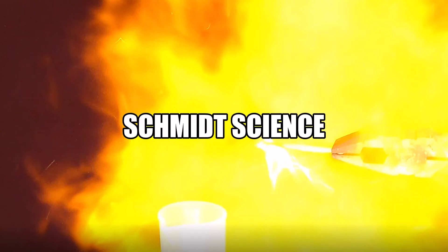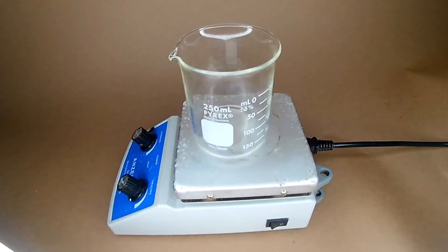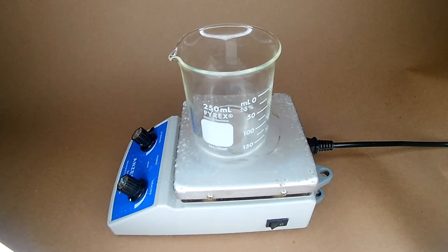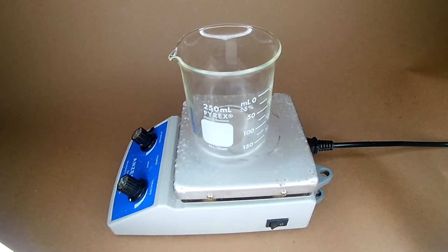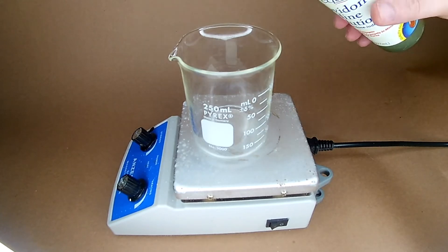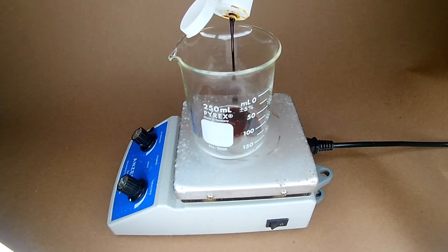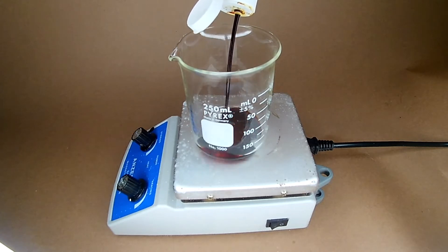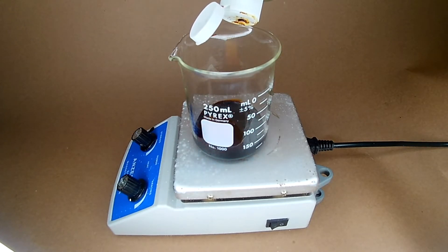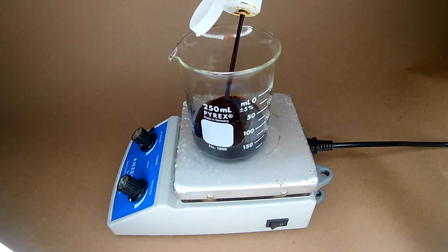For science! This video is an extract of iodine from betadine solution. If you're looking for a good source of iodine crystals, look elsewhere. I started off by adding 150 milliliters of betadine solution into a beaker.